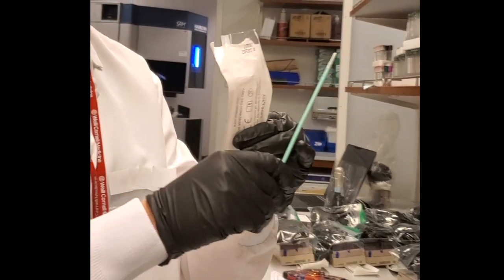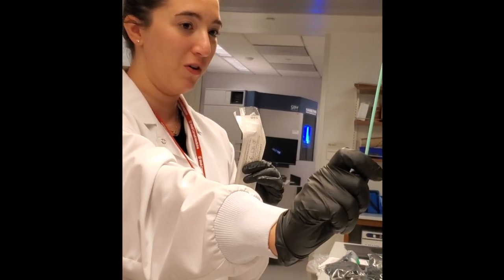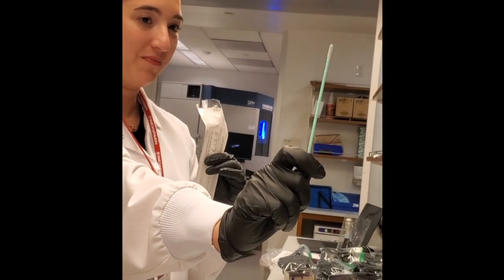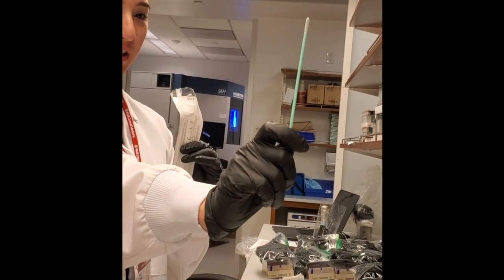Then you're simply going to hold your swab out away from you for 180 seconds. You can have someone else time this for you, or you can simply count.